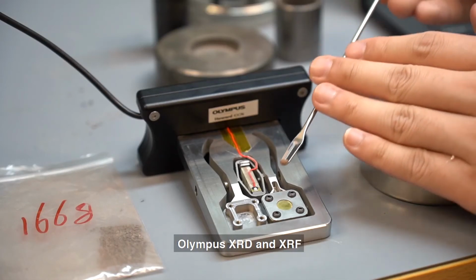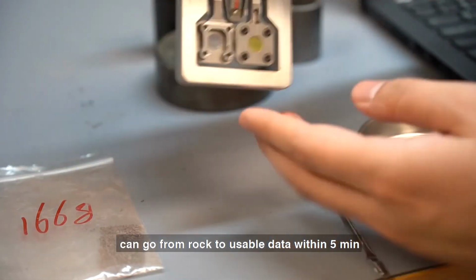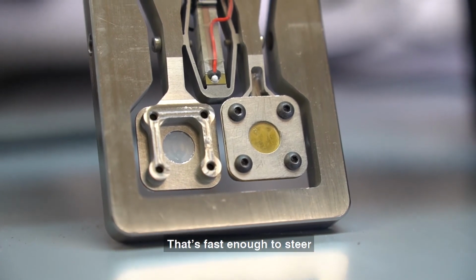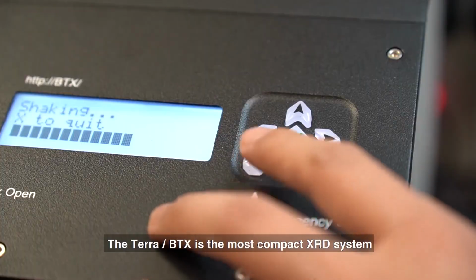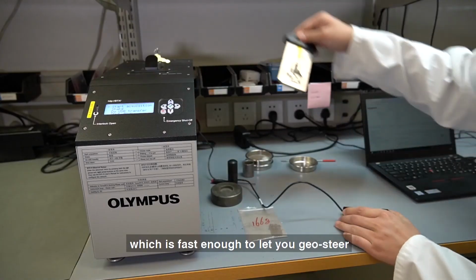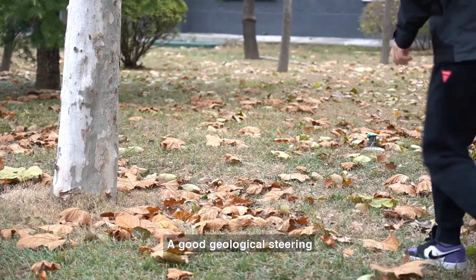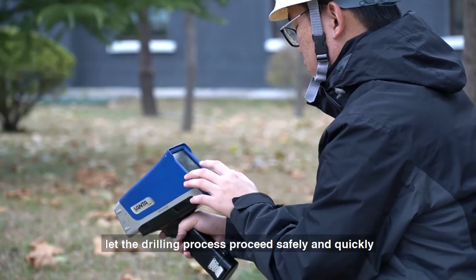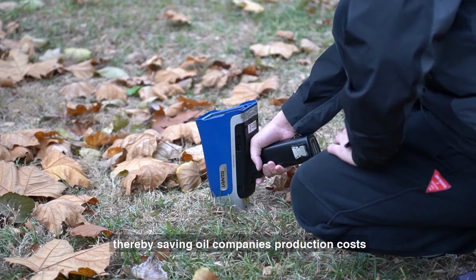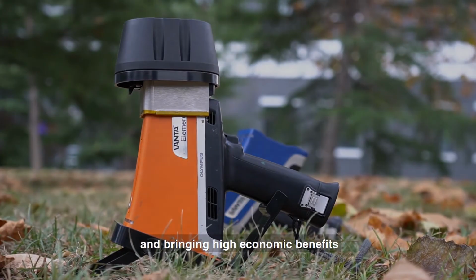Olympus XRD and XRF can go from raw to usable data within 5 minutes. That's fast enough to steer. The Terra or BTX is the most compact XRD system, which is fast enough to let you geo-steer. A good geological steering lets the drilling process proceed safely and quickly, thereby saving oil companies' production costs and bringing high economic benefits.